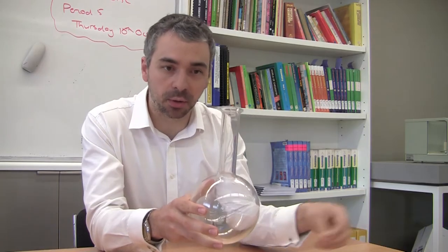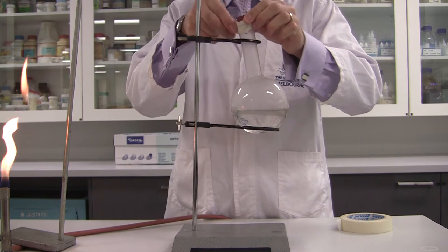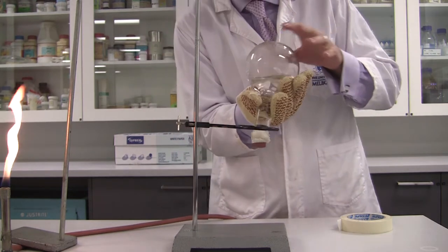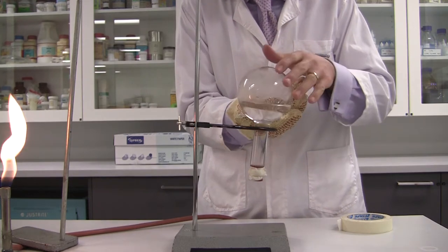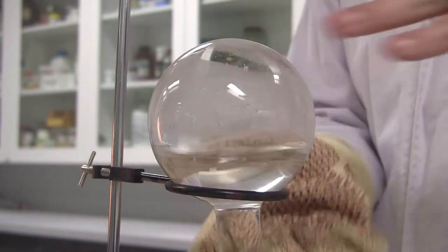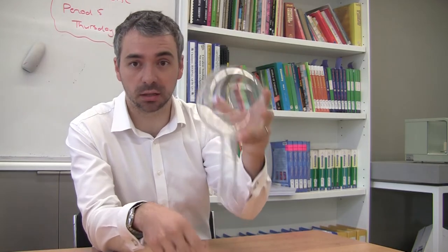And then take the Bunsen burner off quickly, put a rubber stopper on there and tape that up really, really tightly. We don't want this to get loose because what we're going to do is then when that's really tightly on, we're going to quickly invert it, so just clamp it back on the boss head clamp. An O-ring might be a good idea, if you can get an O-ring boss head clamp you can just put it straight through the O-ring and it's just sitting there already.